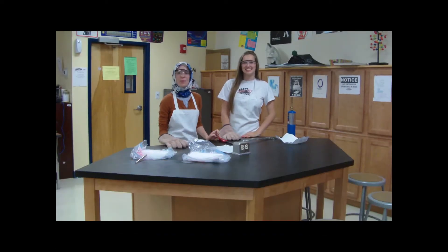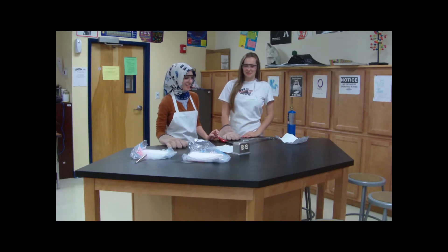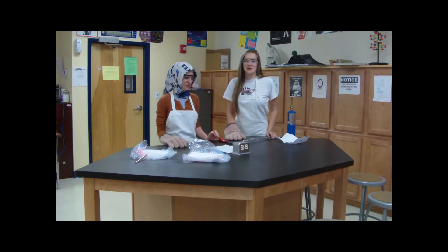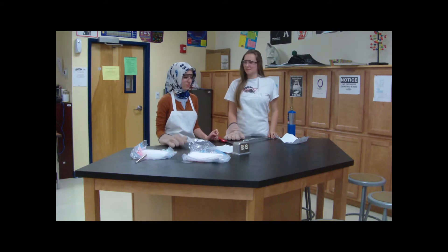Hi, I'm Alma Kovac, and I'm Aliyah Karakoyan, and we're from River City Science Academy. Today we're going to be performing an experiment called the burning magnesium in dry ice experiment.